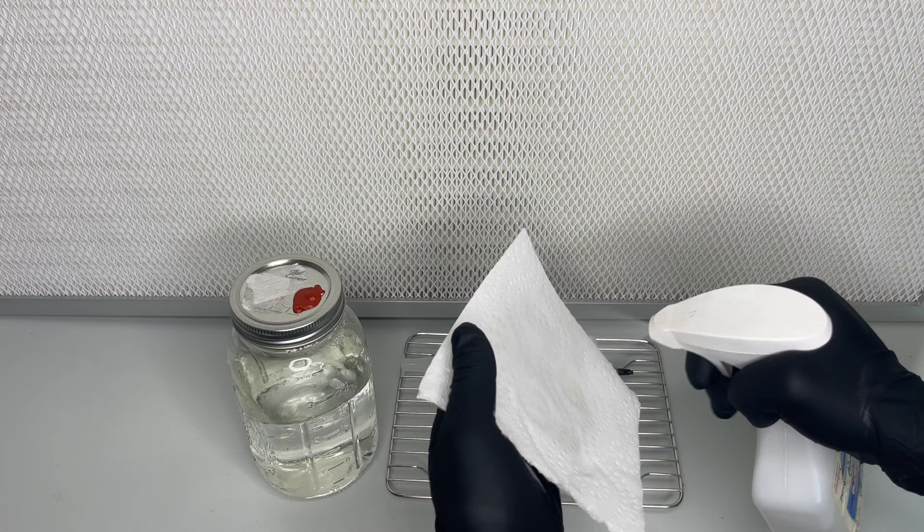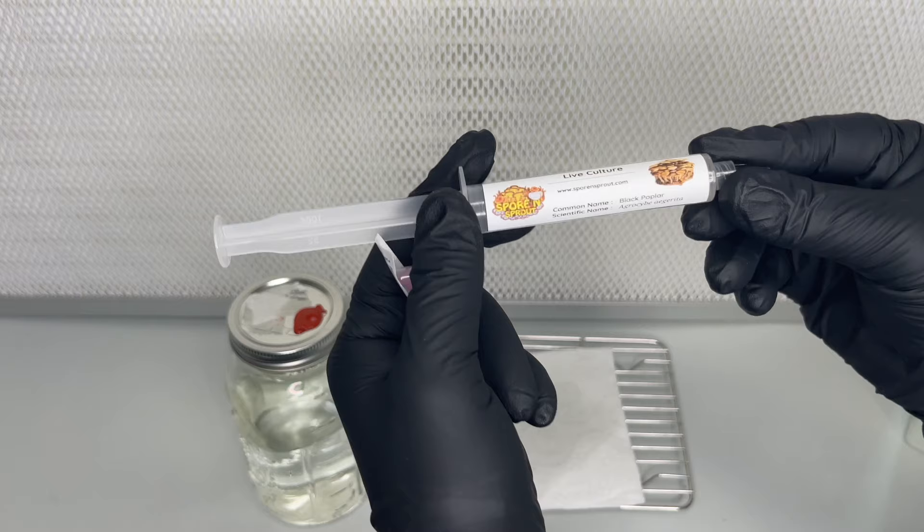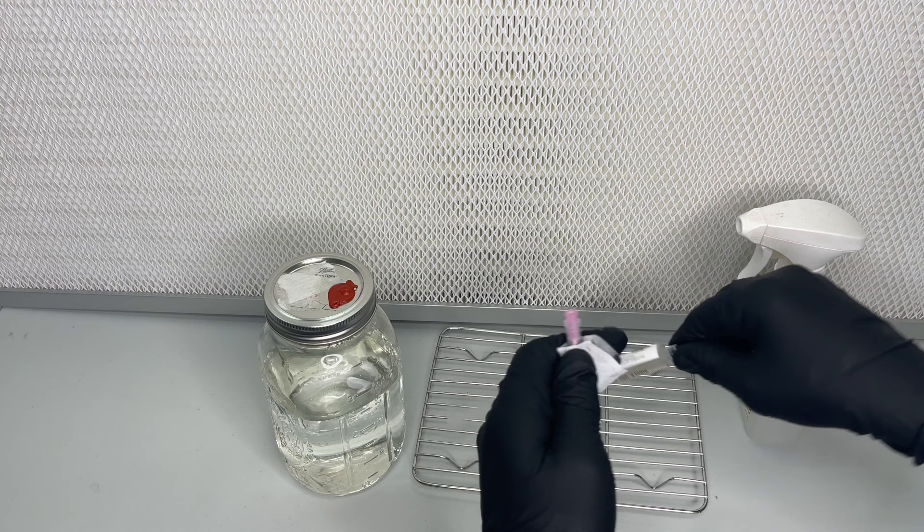After the jar has cooled down overnight, it is ready to be inoculated. You can use an agar wedge, a spore solution, or liquid culture.